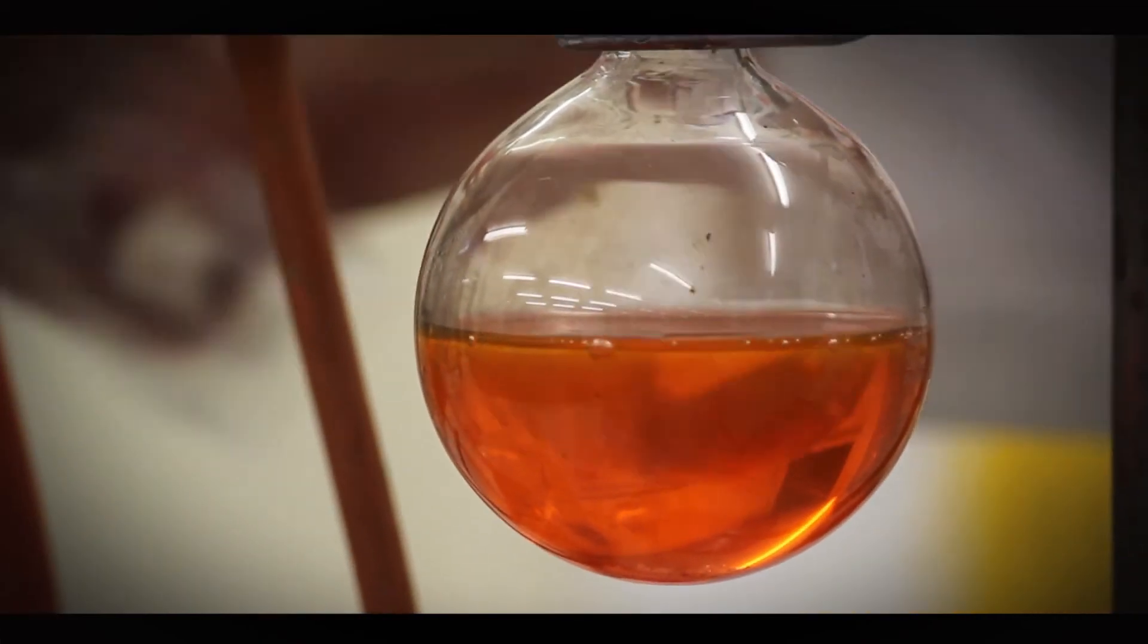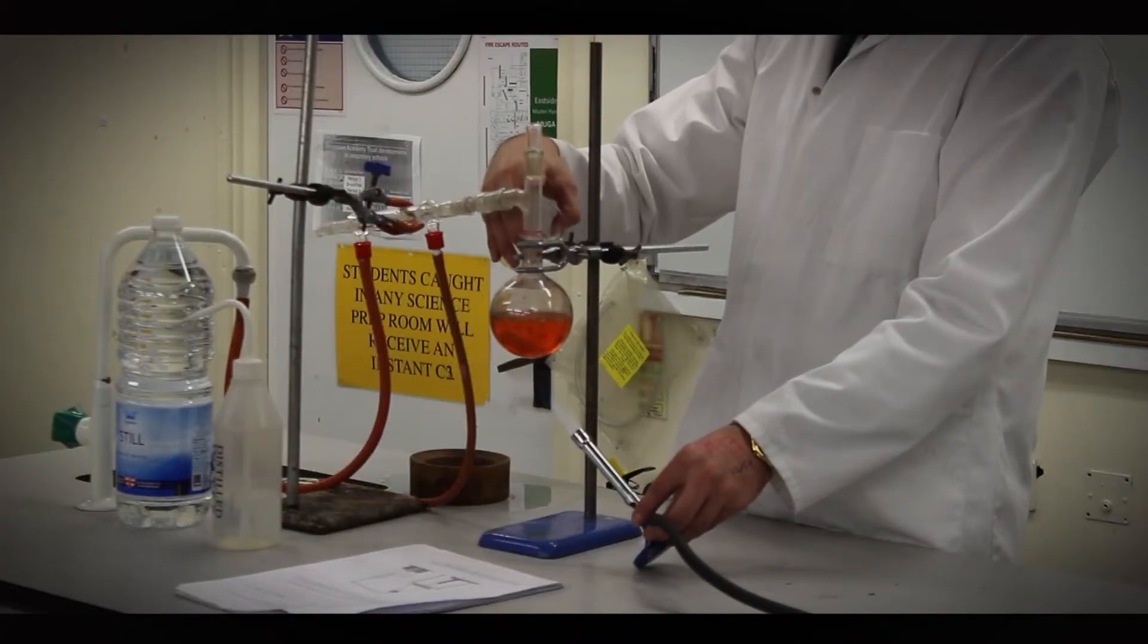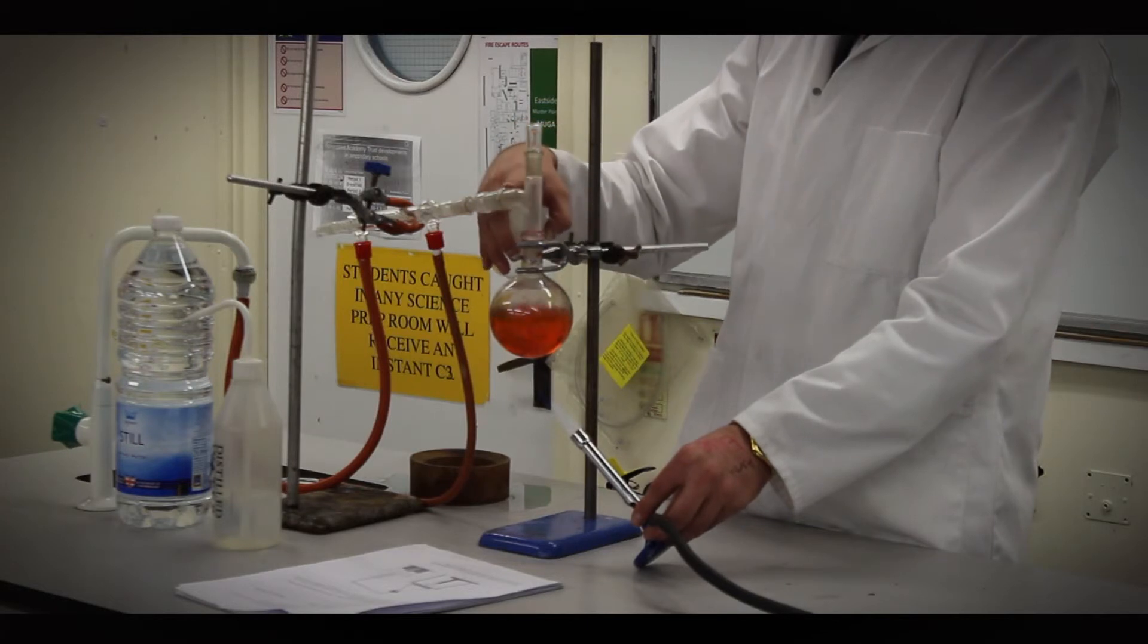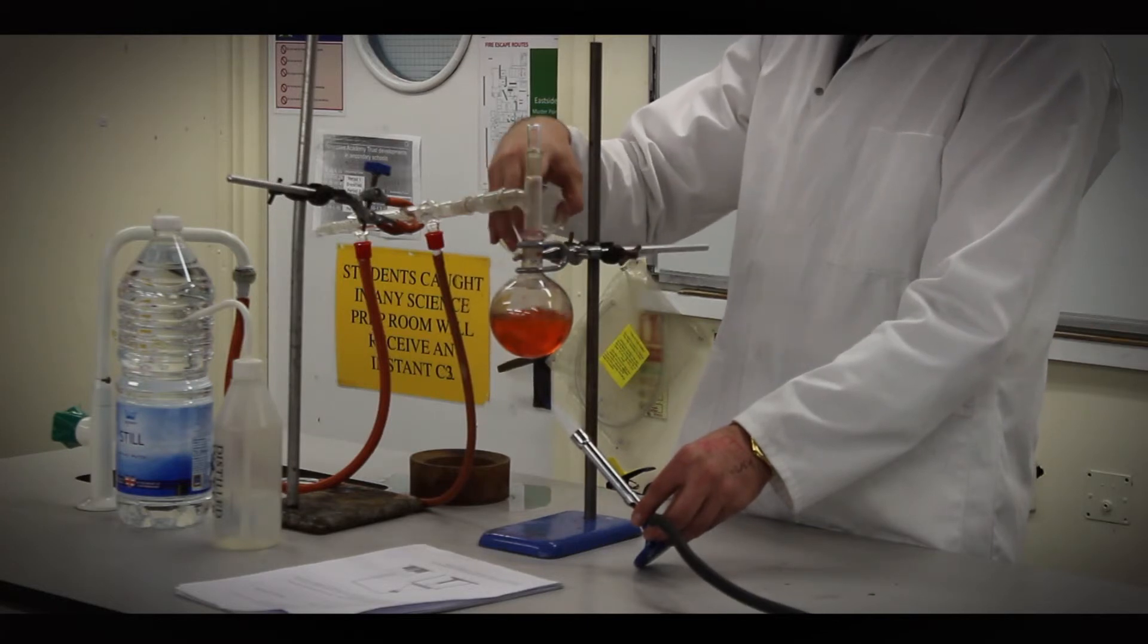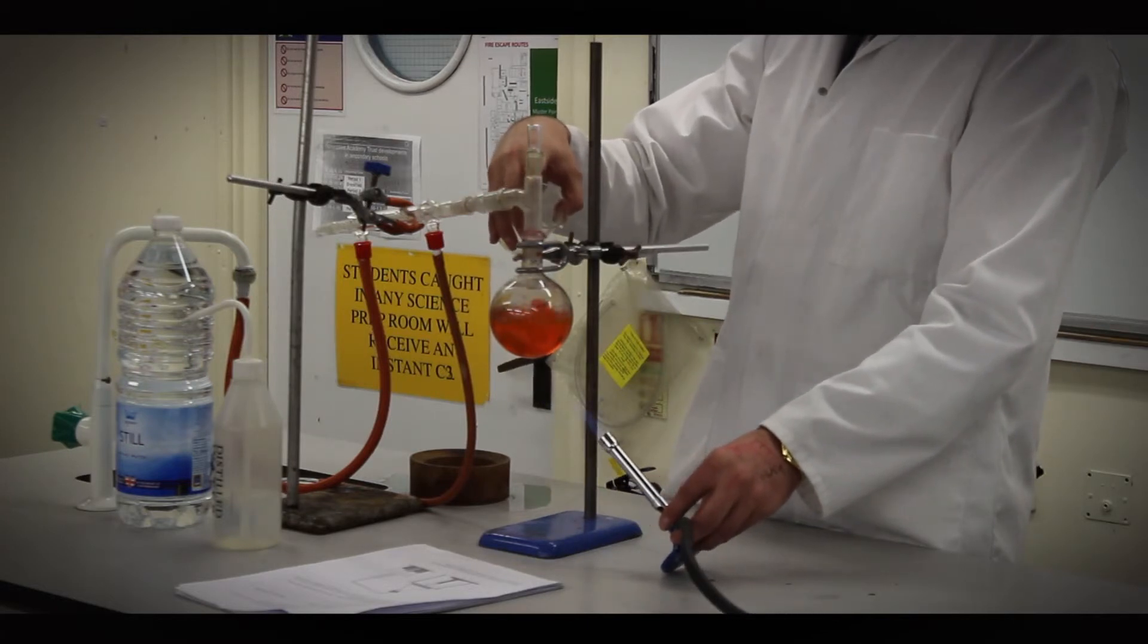So I'm going to hope that it will evaporate, and you can start to see some gas come up there, and it will start to condense. And I'm starting to see some liquid there.